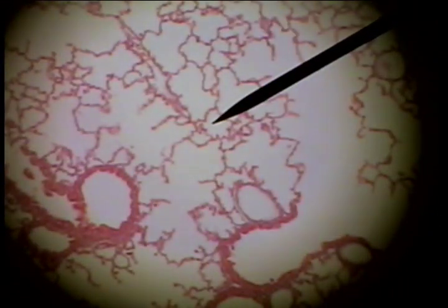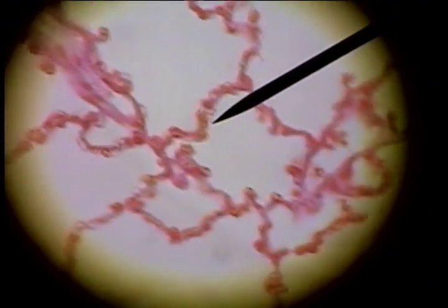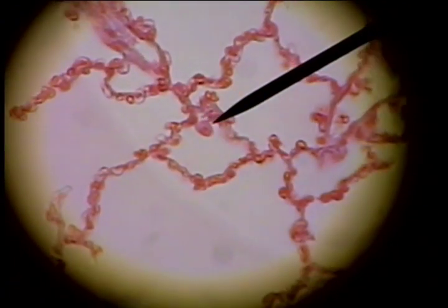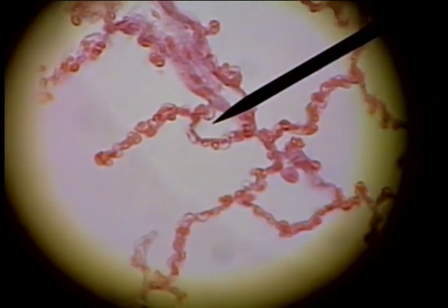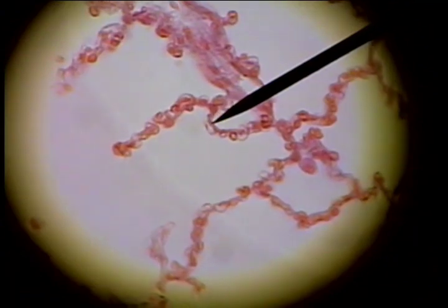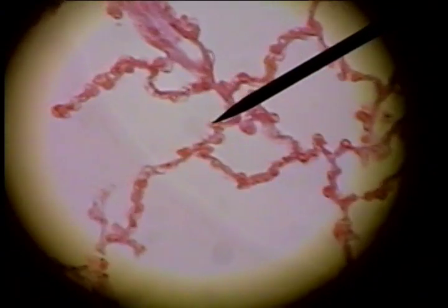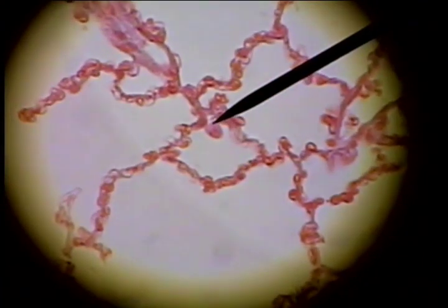we see there are two major cells associated with the construction of the alveolar air sac. One is a larger cell, such as this cell here — that's a pneumocyte. This would be pneumocyte type 1, or simple squamous cell, and this would be pneumocyte type 2, which is a surfactant-secreting cell.